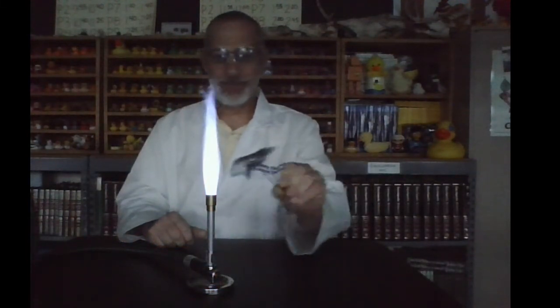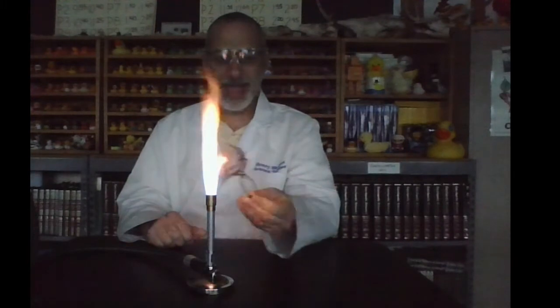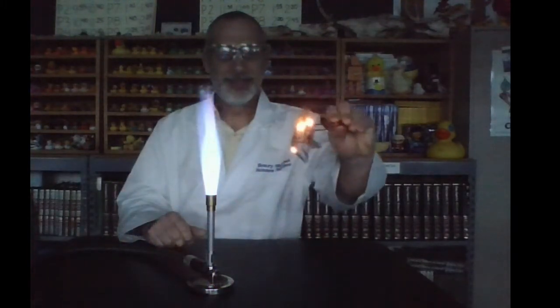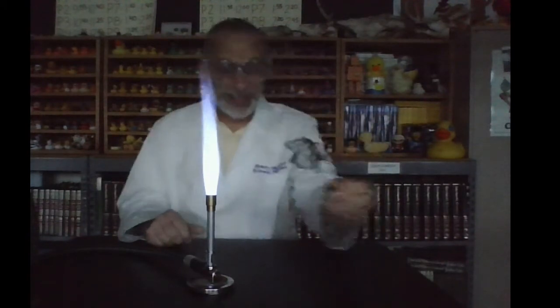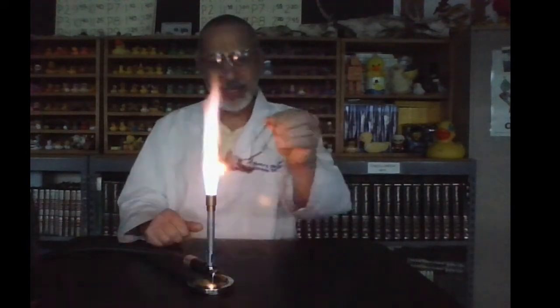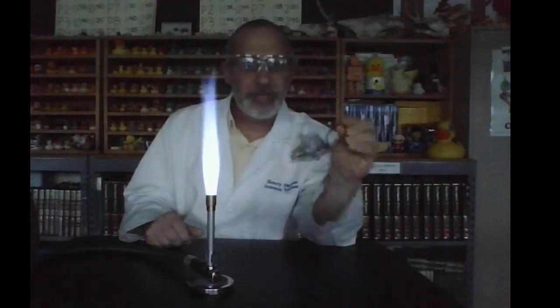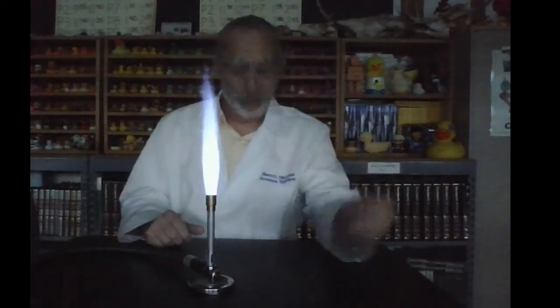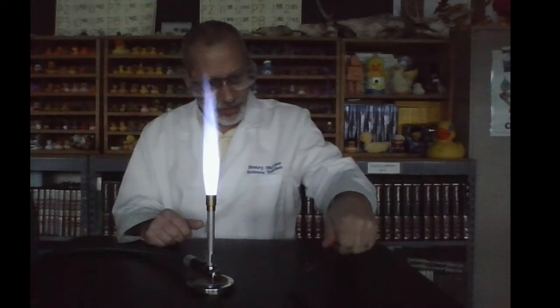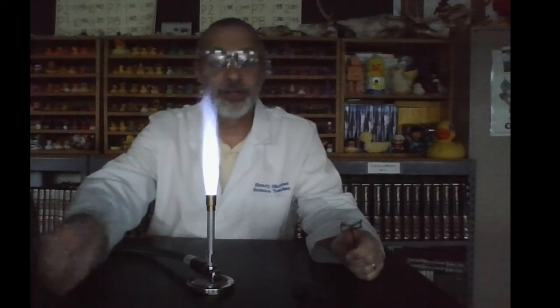Check that out. So we know what the iron looked like beforehand — we can see what's happening here now. It's like mini fireworks! It's so cool. I love this. After a while, we will see that no more reaction is taking place, and that's when we know all of the iron has mixed with as much oxygen as it's going to. So I'm going to put that on our lab table. Pause the video now to record your observations of the iron combining with oxygen.